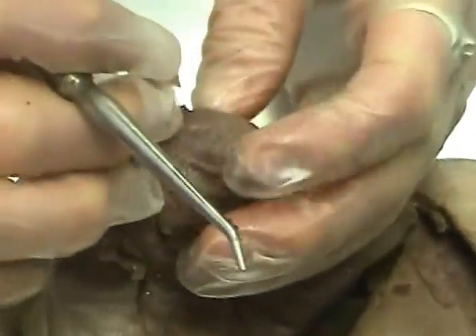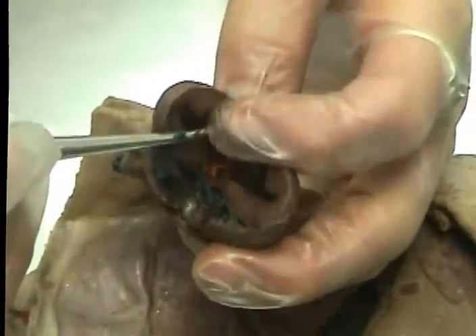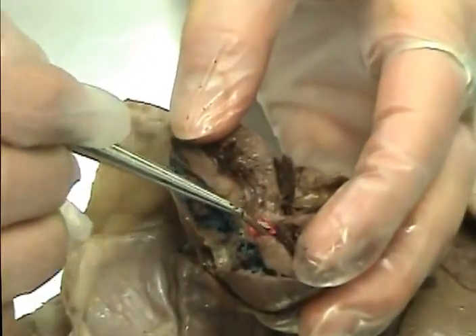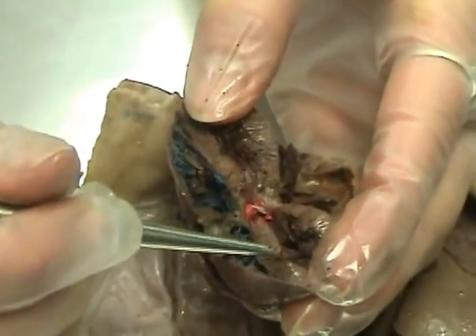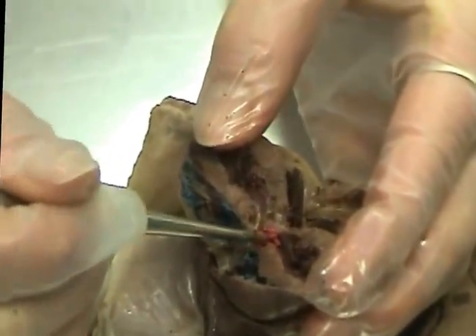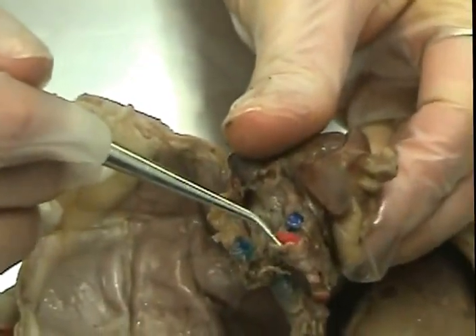Those dump into the left atria, which is right there. From the left atria, it goes to the bicuspid valve, which has lateral and medial cusps. Goes into the left ventricle and pumps out through this pink thing right here, which is the aortic semilunar valve. It's really good. And out through the aortic arch to the body.